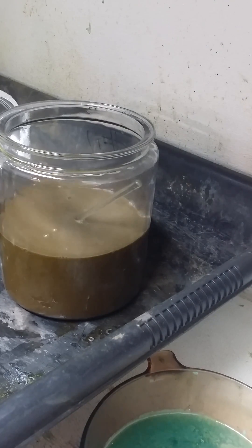As you can see, the solution turned a really muddy brown color. That is the sulfur dioxide bubbles reacting with the dissolved gold on a molecular level, and that is pure gold. It will now settle, and then we will take a picture of the solution so you can see the brown powder at the bottom, and we'll see how much we get.